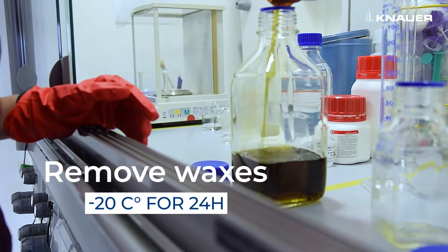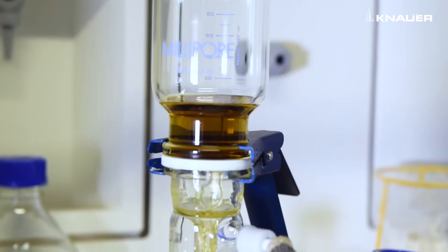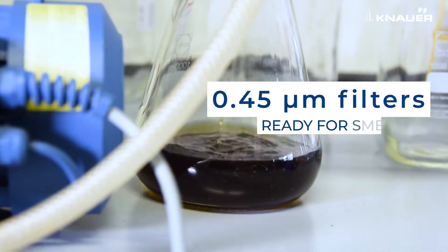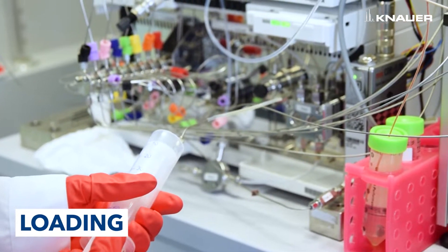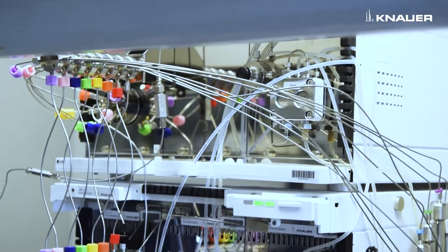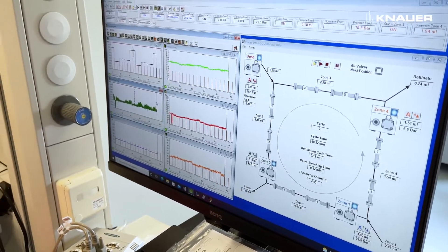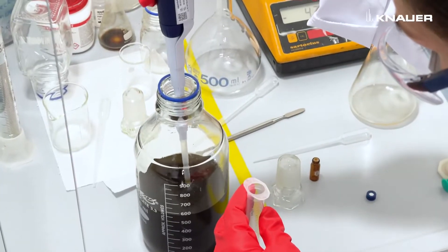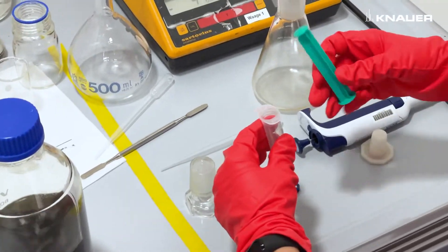The concentrated extract can then be dissolved in the desired solvent for the purification step. In order to remove waxes, the feed is placed at minus 20 degrees for 24 hours. Prior to loading, the sample is filtered through 0.45 micrometer filters. After that, the sample and the mobile phase are loaded in the SMB and the system can be started. Raffinate and extract fractions are analyzed to check the separation efficiency, the purity, and the concentration of the target.